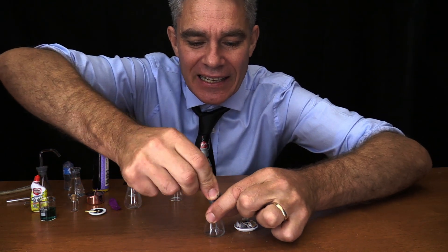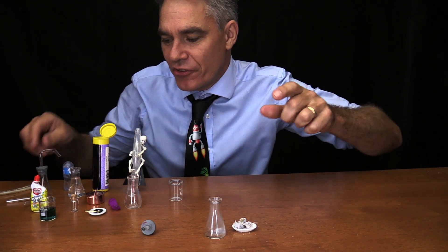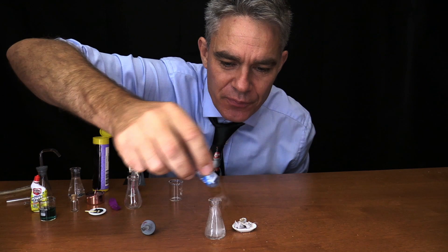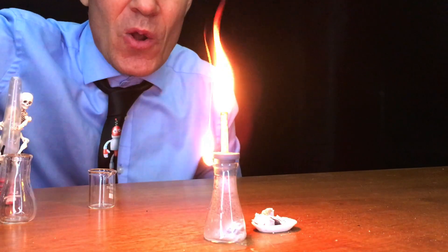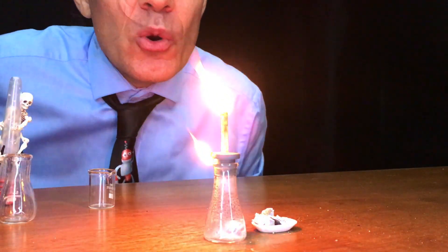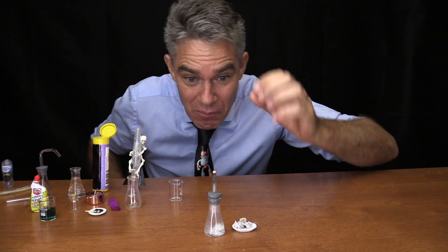This time I'm going to put a piece into this conical flask. I'll put a chunk of calcium carbide in there — it's already starting to fizz, there must have been some water in it. I'll put some more water in it and light the top. Look at that beautiful flame! With a bit of oxygen, that flame could be used in a miner's helmet down in a coal mine.